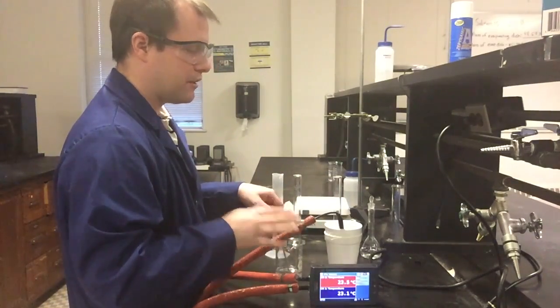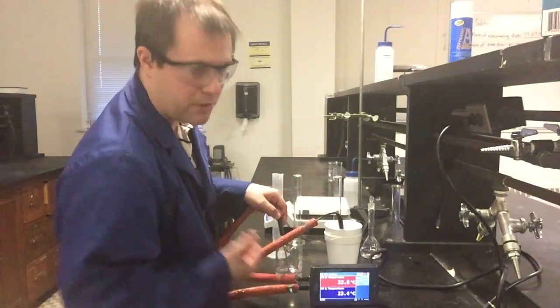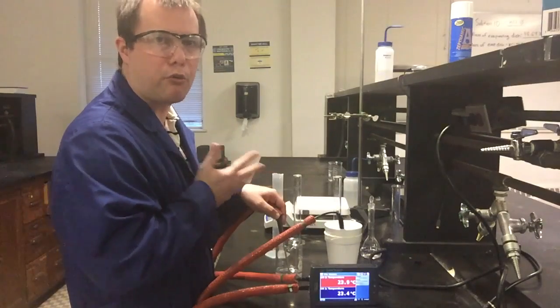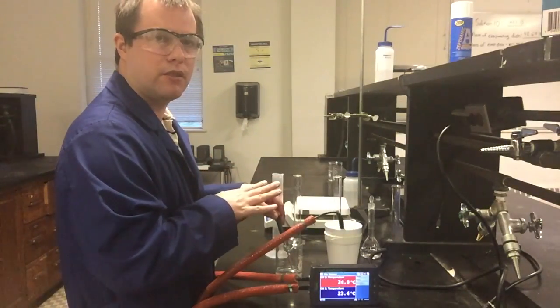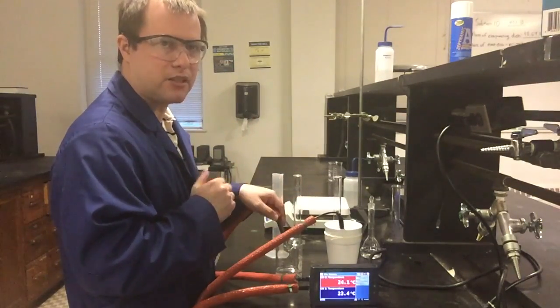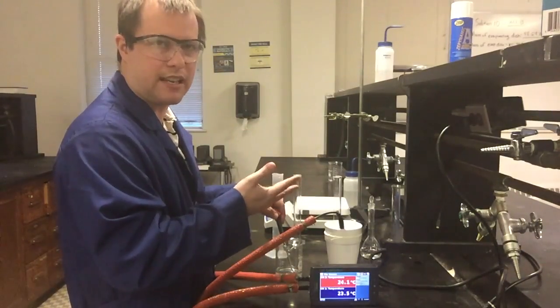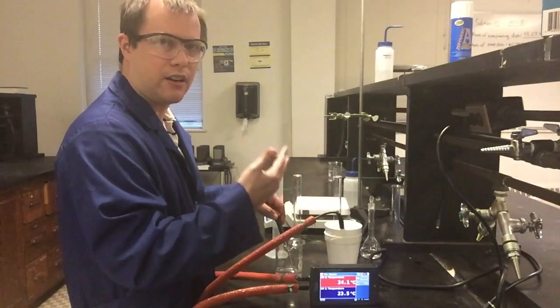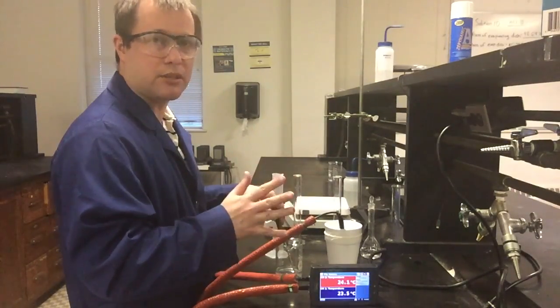And what I'm going to do is leave these, and hopefully these temperatures should be reasonably close together, should be pretty close to room temperature, since that's kind of where we've been working with everything. And I'm going to record this temperature for 5 minutes. And so you're going to see that here. I'm going to clip this on the video so that you don't have to just stand here and watch for 5 minutes while I hold stuff. And then what I'm going to do is mix things together. So I'll show the clip again of mixing together, and again a clip of the end data of what everything looks like on the LabQuest, and kind of summarizing what to expect and what to look for.